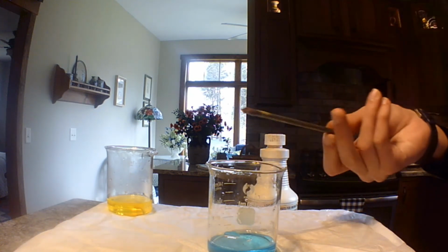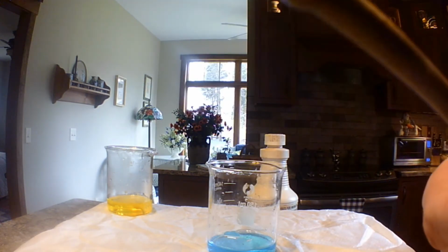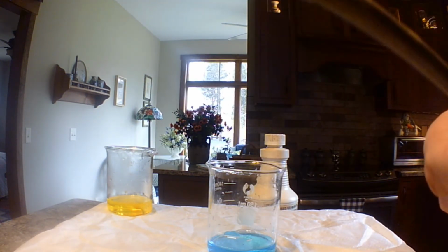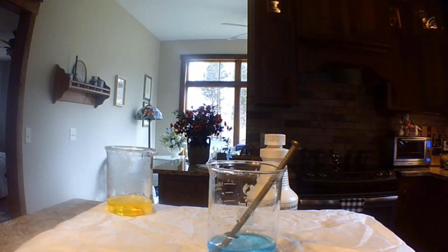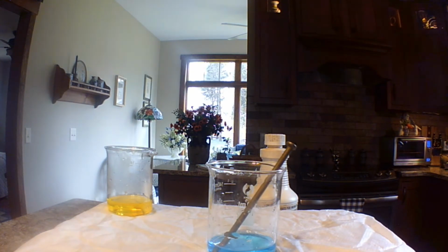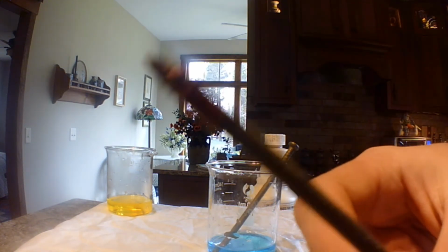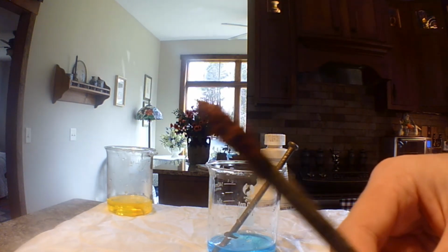You can see it a little bit now. That's copper on the outside. You can see the gray nail, and there's the red tip of it. That's stuff that's put in the solution. That's the copper. I did this one a little bit earlier, and this is what I was leaving in for a while.